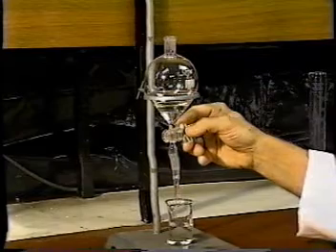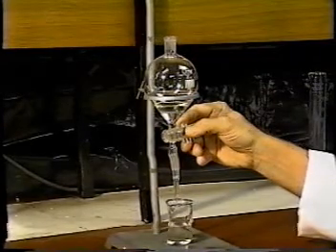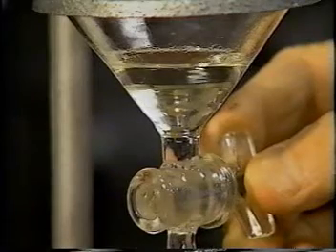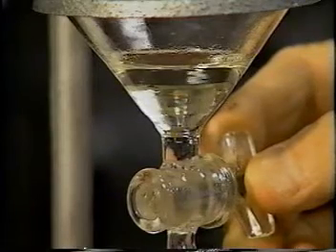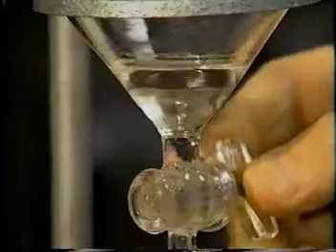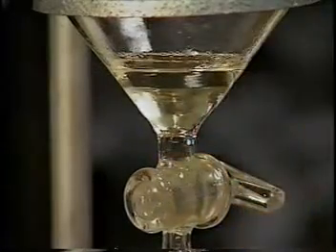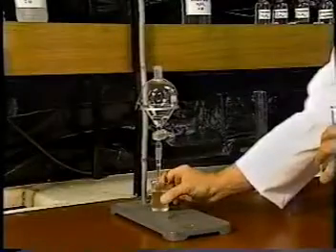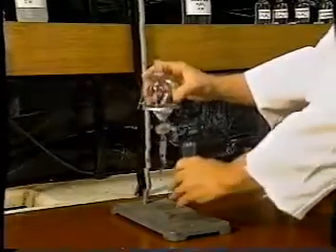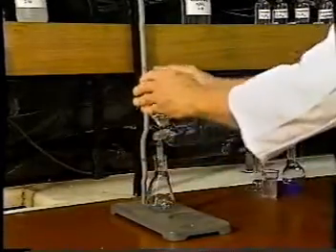Again, we drain the aqueous layer carefully. We discard the aqueous layer and collect the ester in a clean flask.